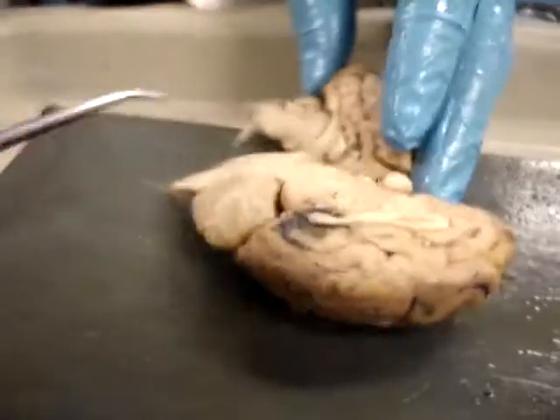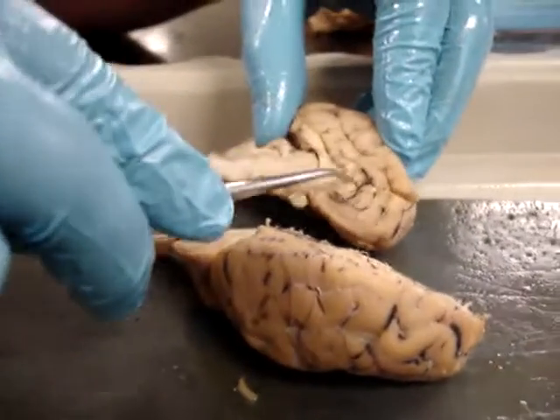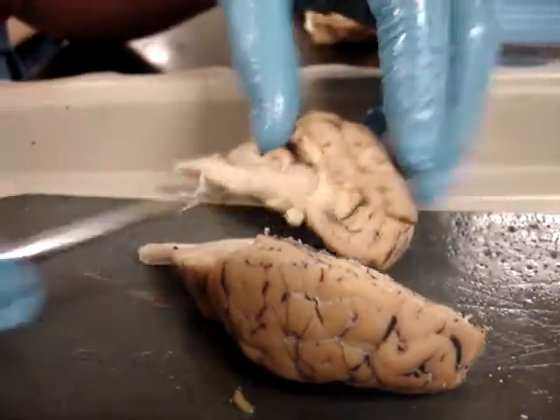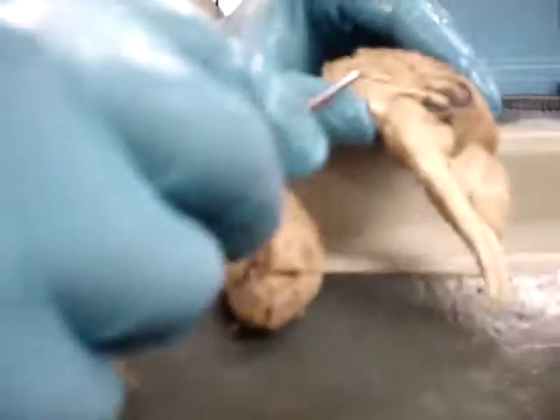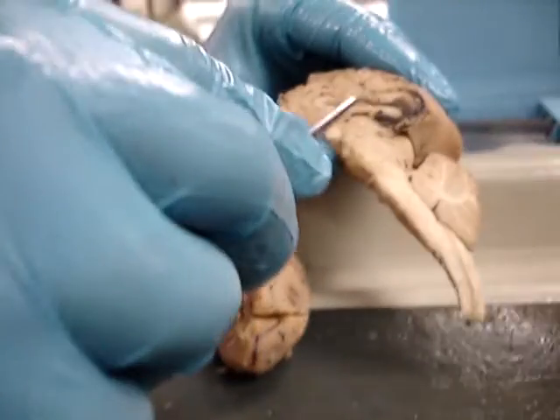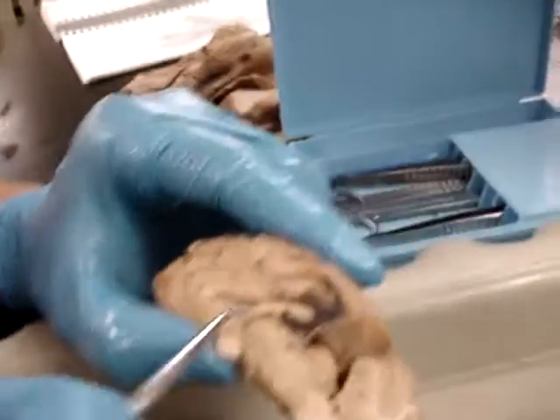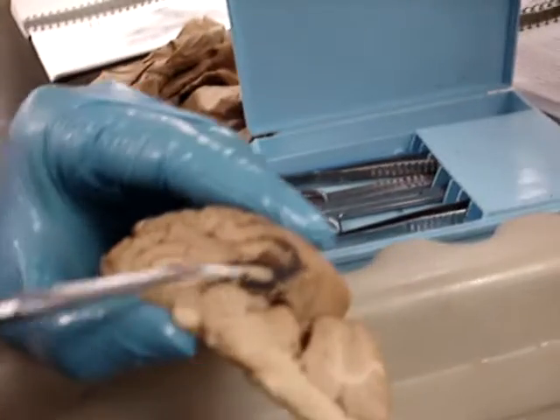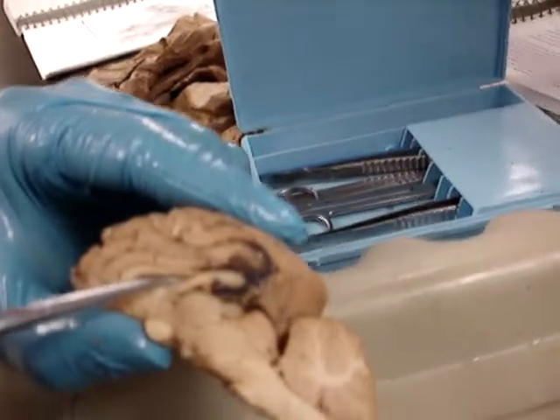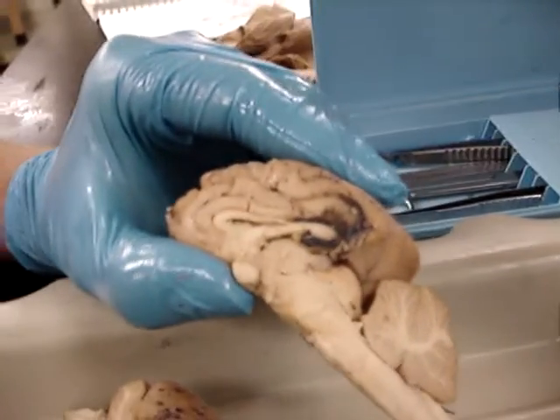Corpus callosum — on the inside, the corpus callosum is just the top part. So the corpus callosum is the top, and the actual gap in here is the lateral ventricle.